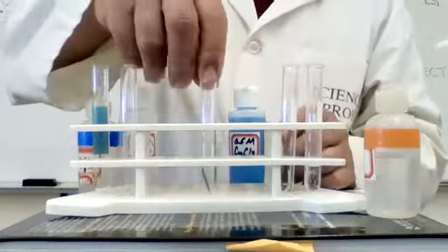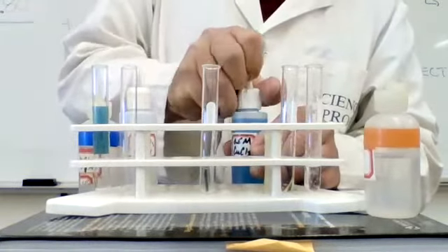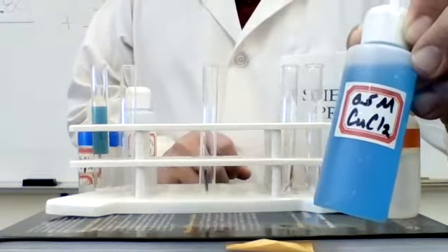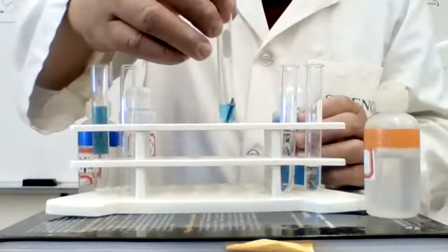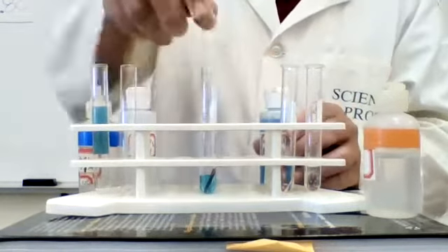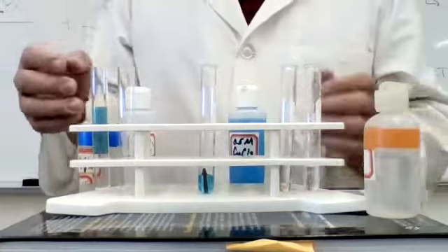Now, another example would be like here where we have an iron nail and we have, in this case, copper 2 chloride. Okay, now notice the copper 2 chloride is blue. So another way to recognize whether or not a reaction occurs is if I put this in here, okay, what we're going to do is we're going to let it sit for a few minutes. Okay, and I'm going to go on to another demo, and then when we come back, I will show you the difference.